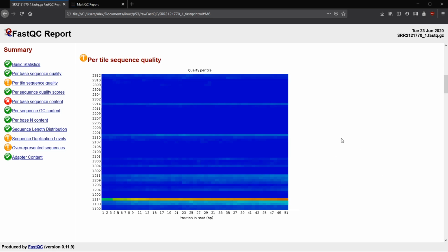A warning here comes when a particular tile, so a row, has a quality score more than 2 less than that average for that column. So here, I'm guessing this is where our sequence quality warning, so the yellow exclamation mark, is going to be that warning. So along here somewhere is probably the mark of where less than 2 of the average column comes into play. And then it's going to be a failure, so we'll have that red X, if any particular tile has a quality score of more than 5 below. So whatever the column average is, if this one was more than 5 less than that column average, we would get a failure.